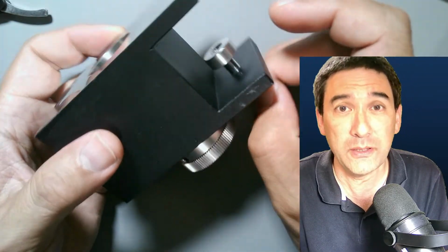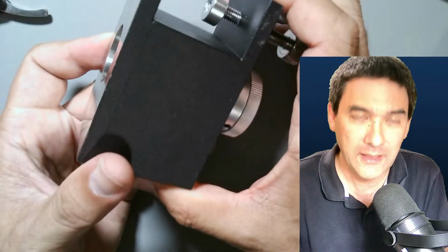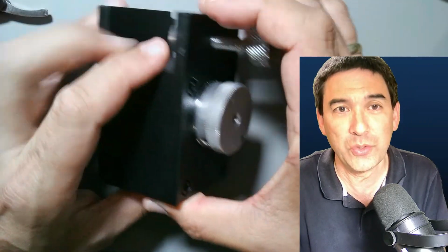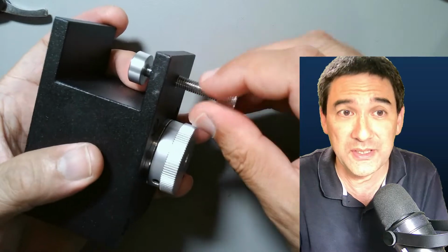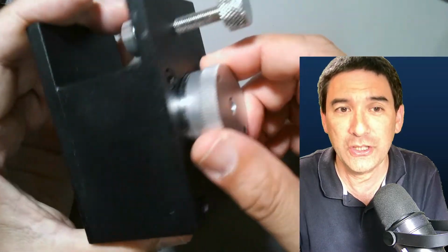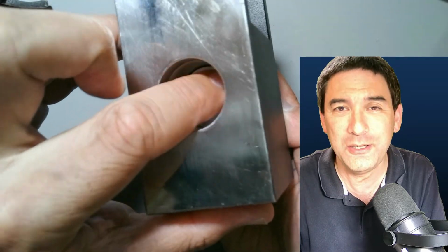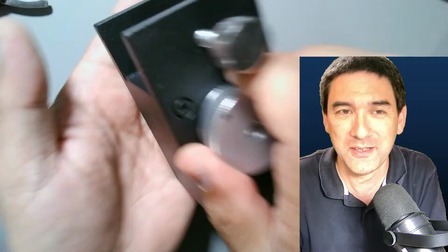There are some delivery costs, of course, but when it arrived, I kind of liked the unique shape a little bit. It can be directly mounted to a table using this clamp, but I just want to show you something here, because that's the wheel that you have to turn to advance the specimen upwards. And you see in this case the piston in here is fixed in place. It does not fall out.